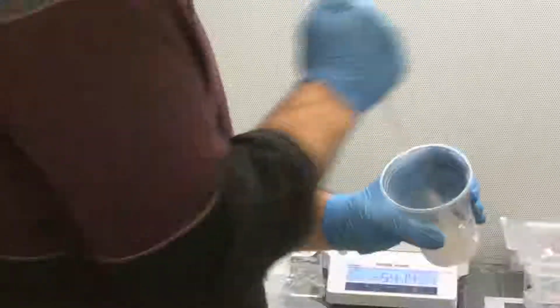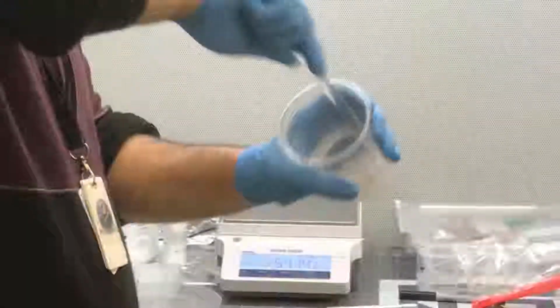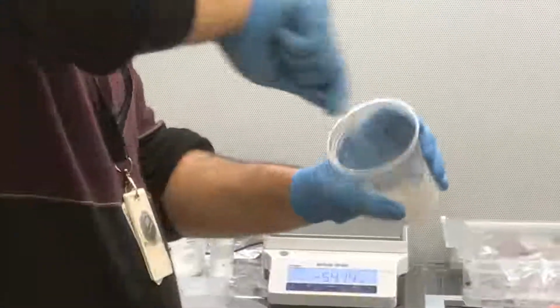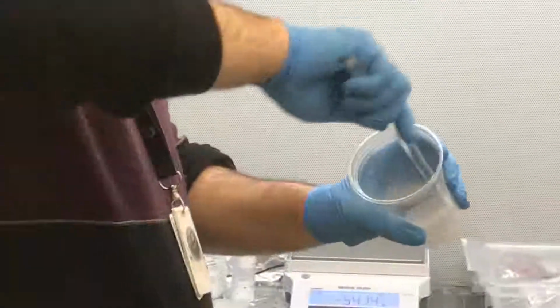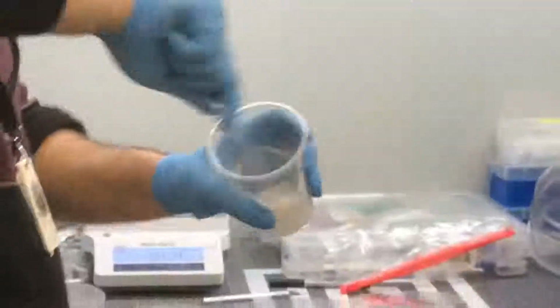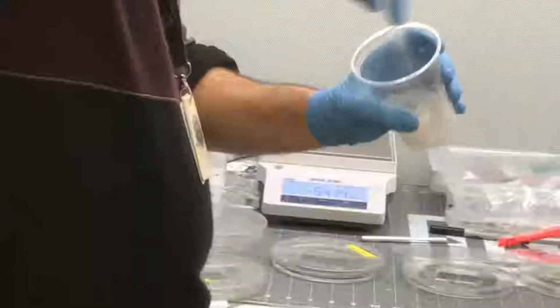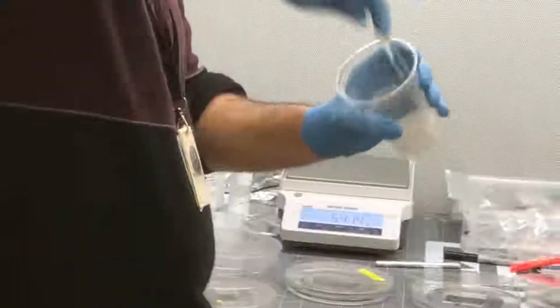Austin, have you written down everything? Yes. Okay. There is an automated machine also for this mixing, where the work is only to mix, nothing else. So this thing we have to find out. Do you know the price? The price is around $4,000-5,000. Oh, really? Yes, but it doesn't work for us because we don't do large scale manufacturing. Exactly. But for larger scale, they have a machine whose role is just mixing. Okay, good.